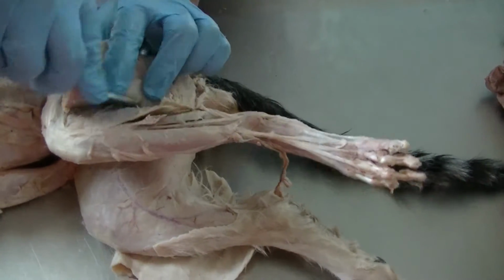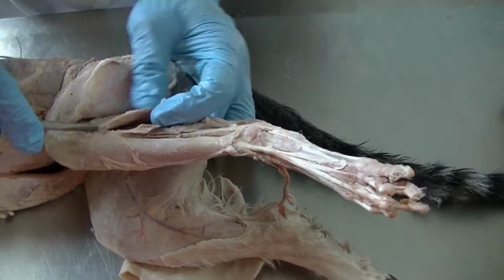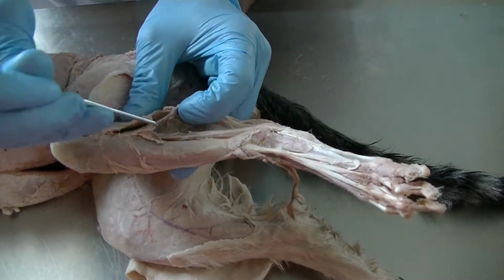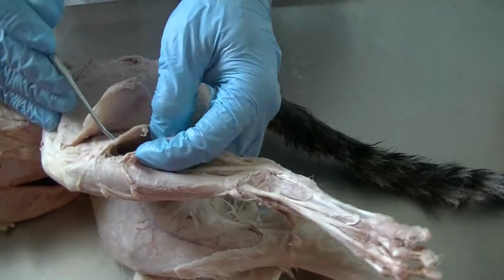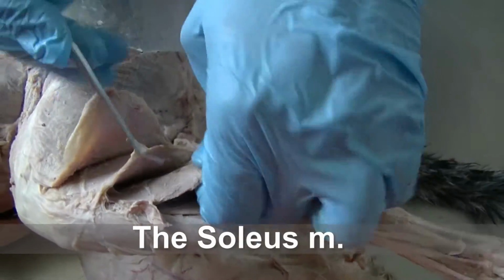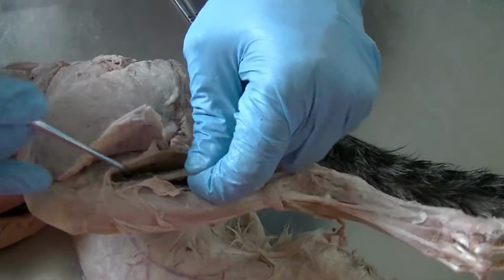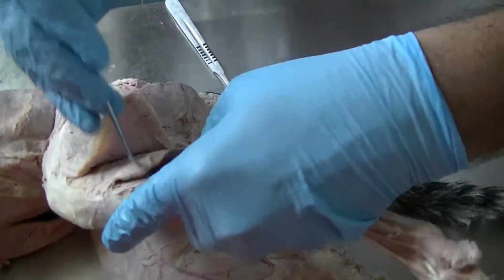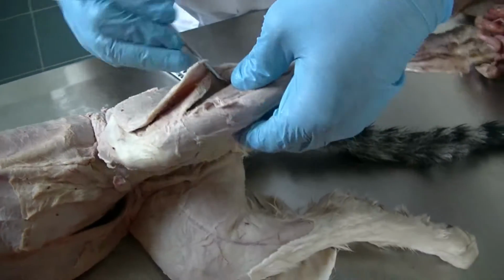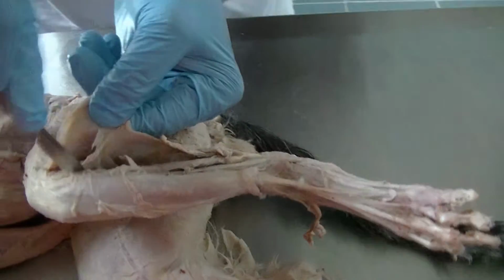Along with the lateral head of the gastrocnemius, we will observe that there is another muscle which runs between the tibia and the common calcaneal tendon, that is the soleus. The soleus, which is fairly large, needs to be differentiated from the superficial digital flexor as well, or it might be confused as the superficial digital flexor muscle.